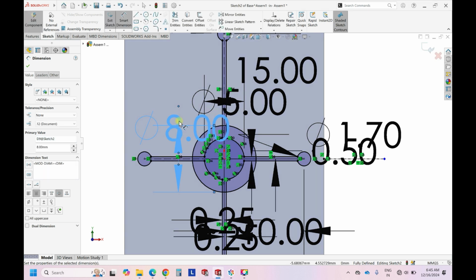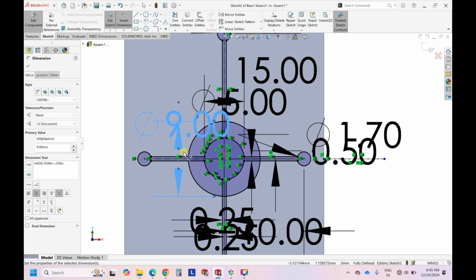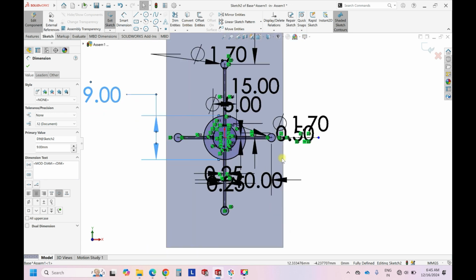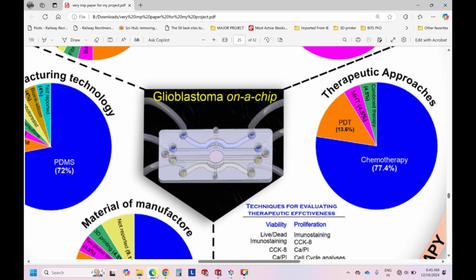so I can give it as 9 or 8 mm, since we need one more circle also out of it. Okay, let's give it as 9. So we have some space. Okay, so 9 mm I am giving it here. Right, so this is 9 mm. And then followed by, we have channels connected to that.